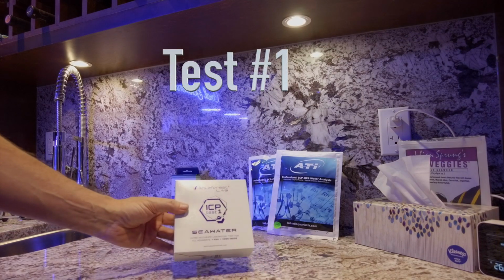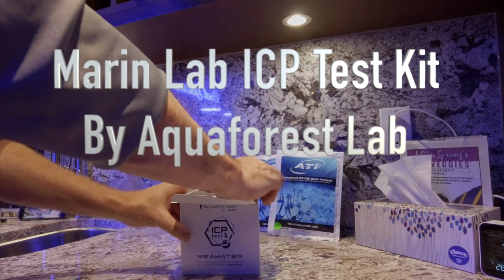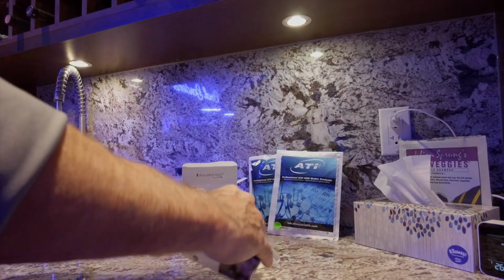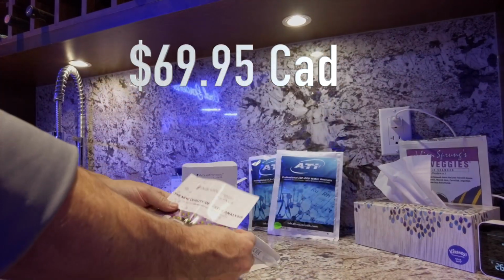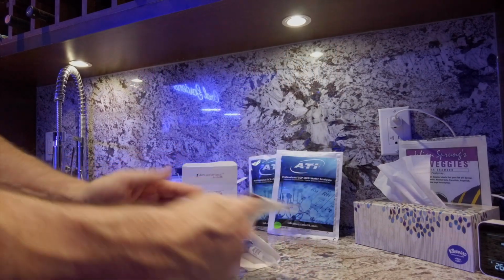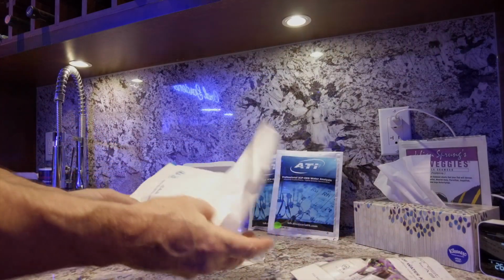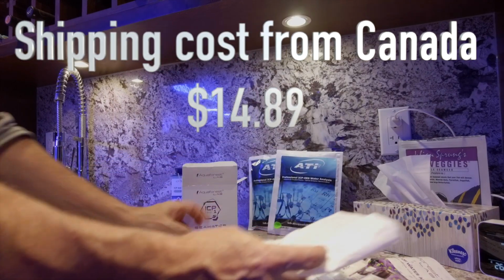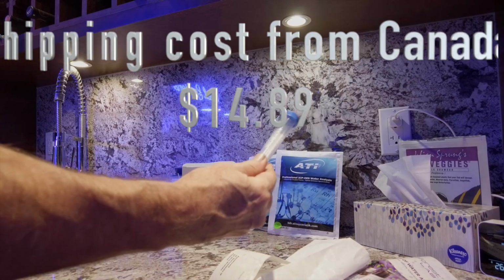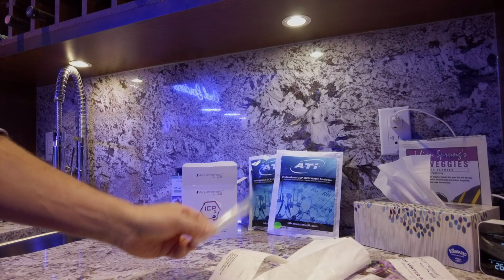Okay, the first one here will be the ICP test by Aqua Forest Lab. Get this opened up. It comes with the information brochure, bubble package for sending it back in the mail, a sticky label that goes on that, and then the water sample tube itself. Let's go collect the water sample here.